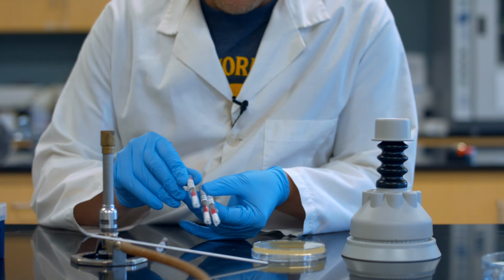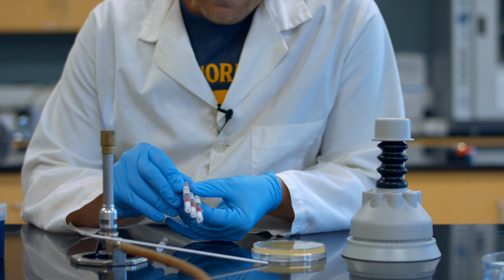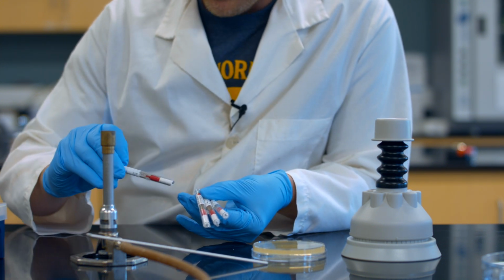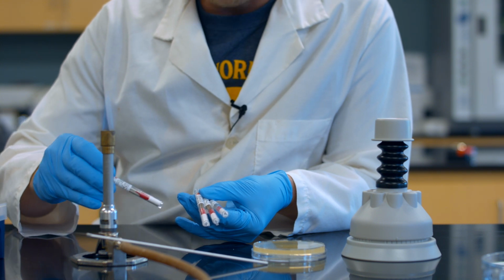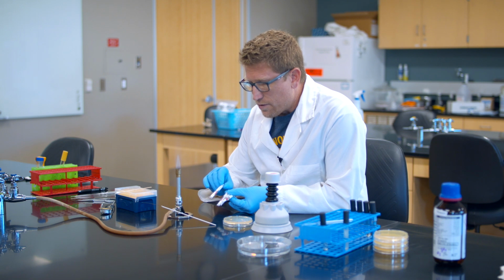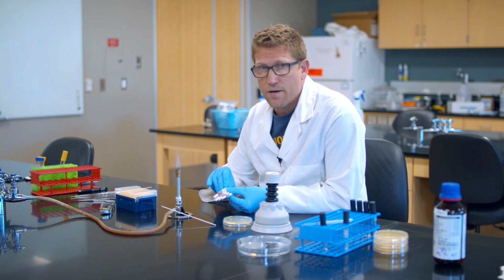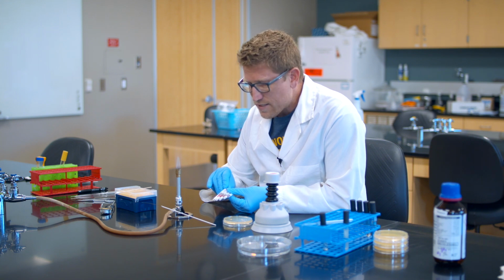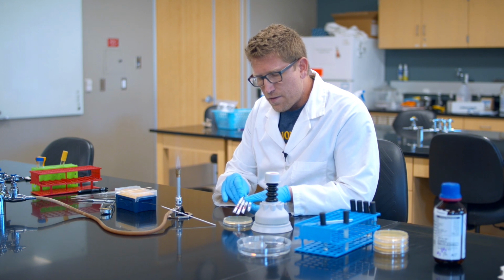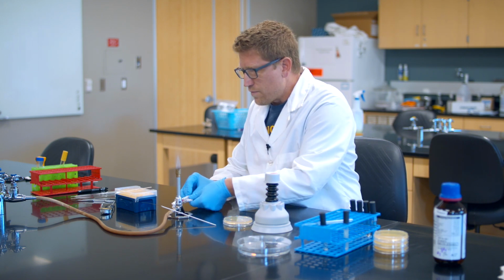I have ampicillin with a beta-lactamase inhibitor called sulbactam that tries to knock out bacterial resistance. We'll see if it works. And then I have one called piperacillin with another beta-lactamase inhibitor called tazobactam. And in class you're going to learn a whole lot about all four of these antibiotics along with a much longer list. So how exactly do I get the lawn on the petri dish, and then how do I get the discs on top of the lawn? That's what I'm going to show you right now.